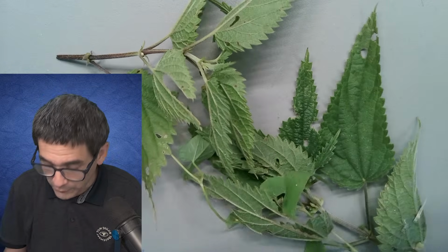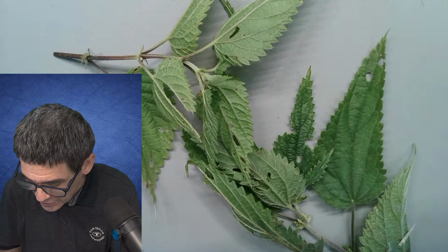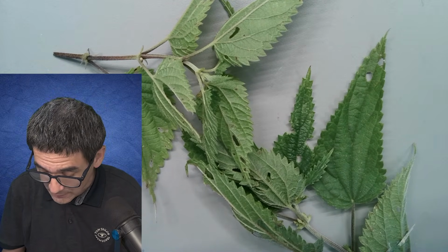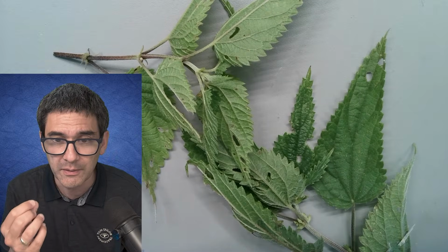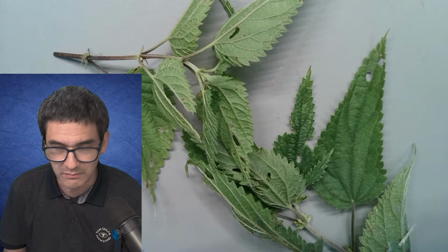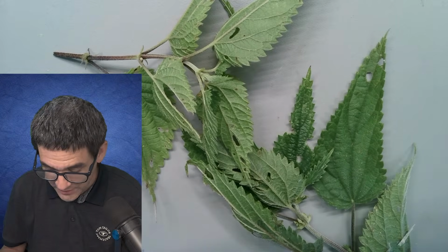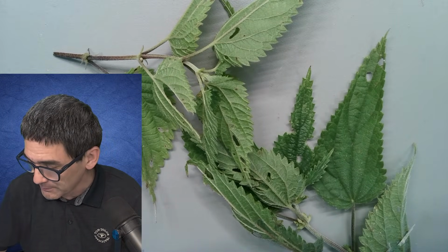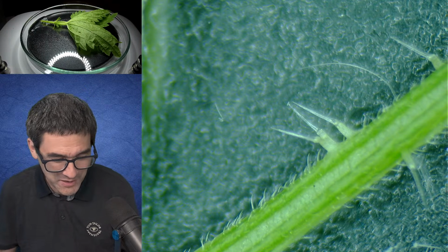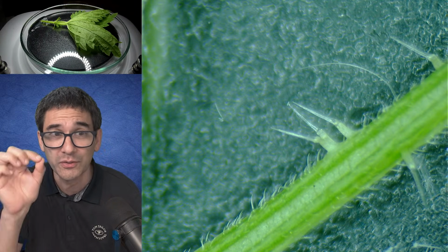So this is stinging nettle, of course, we all know. Look, there's another plant over here. It's not part of it, it's a different one. Of course, we all know that when we touch it, sometimes it can hurt. So why is that? Well, because it stings, obviously, and there is a substance, an acid in there, that starts to hurt a little bit. I'm just going to show it to you directly. The answer to this mystery, which is not really a mystery, I already put under the microscope. Here it is, and that's already the answer to the question. This is the reason why the stinging nettle stings, because you've got those little spikes, especially on the stem.